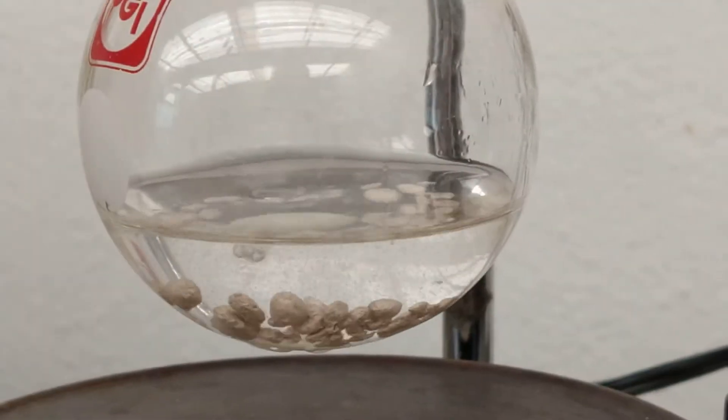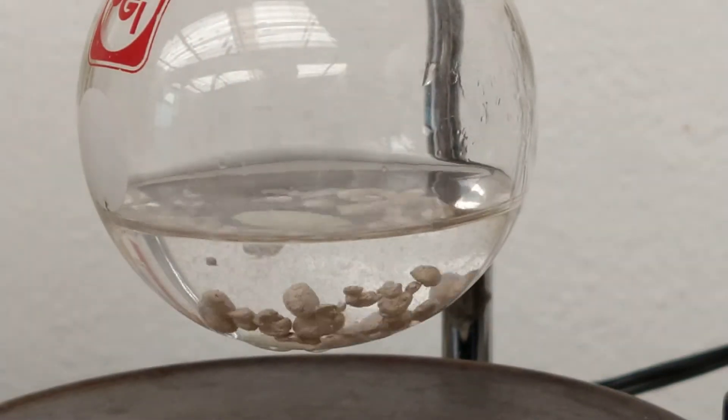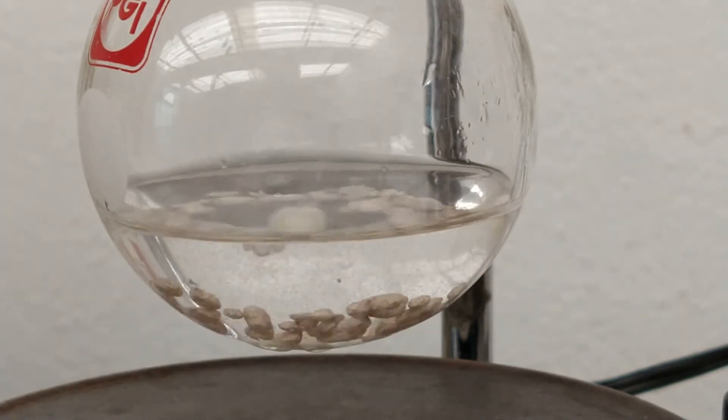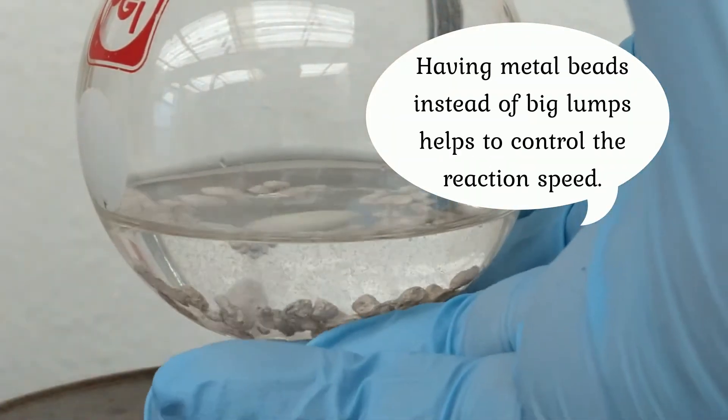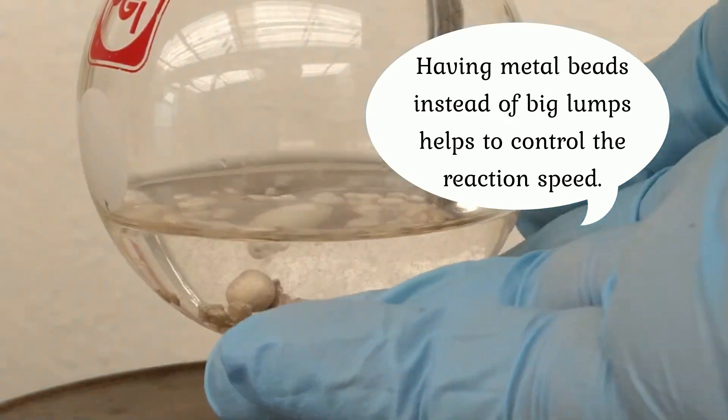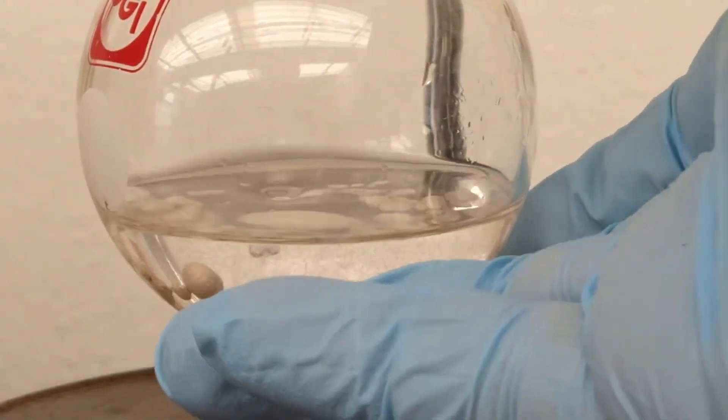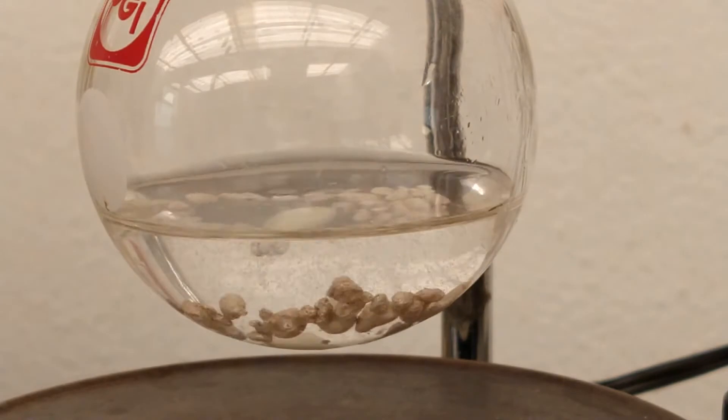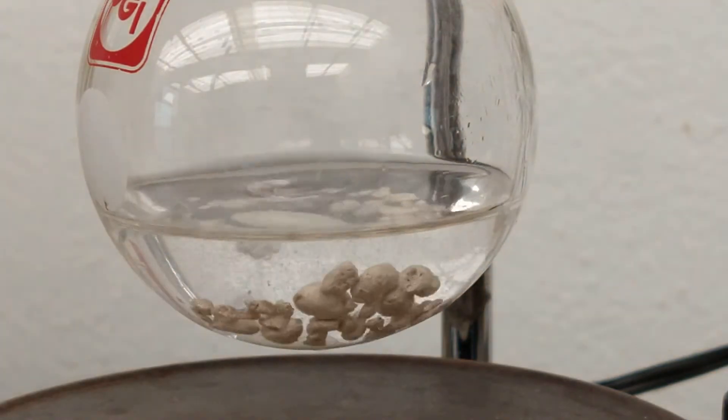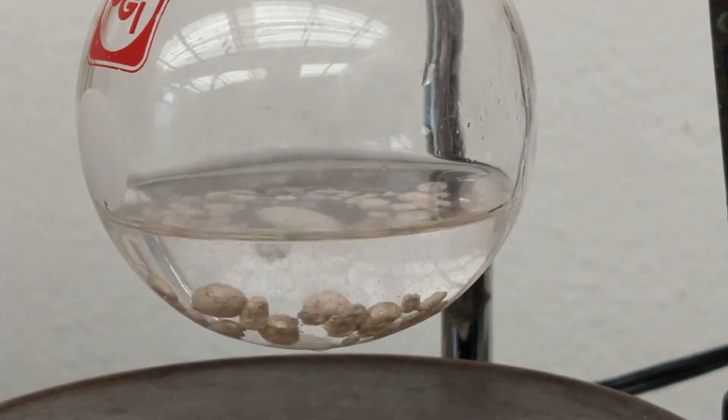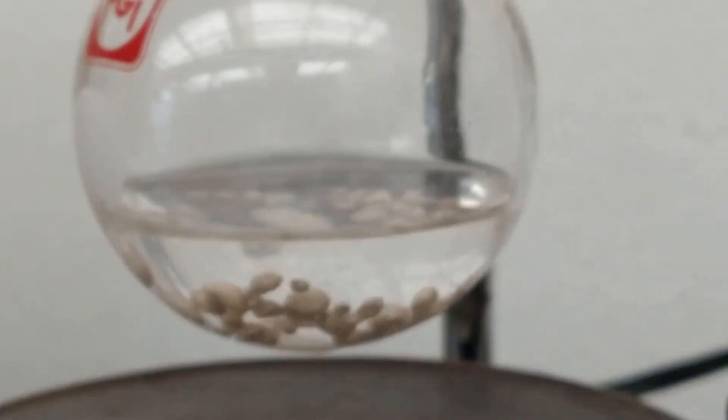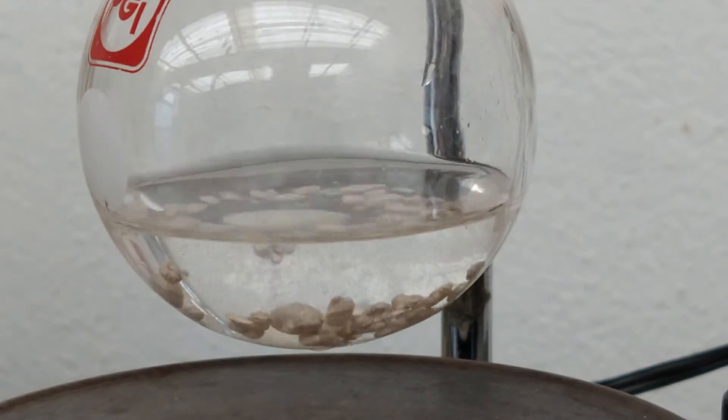This is our reaction and as you can see at first nothing happens, just the beads of sodium floating around. Then when it reaches a moderately high or warm temperature, the reaction is going to take up very aggressively. So we have to be prepared with a container full of cold water just to control the reaction.